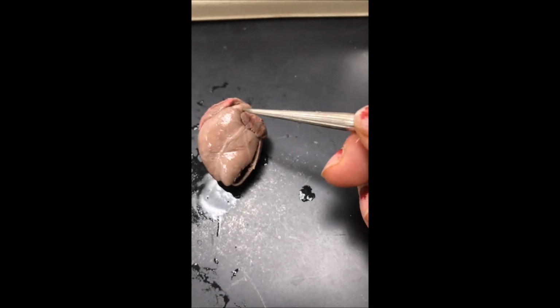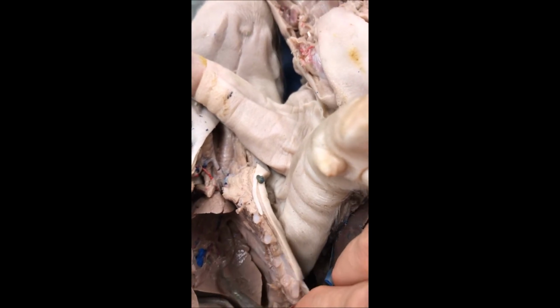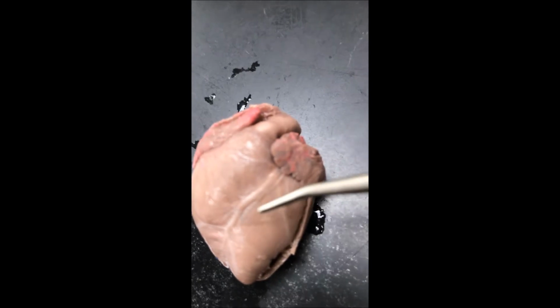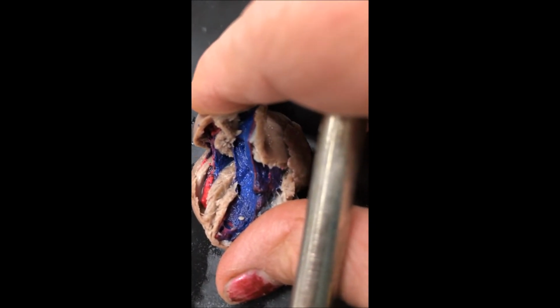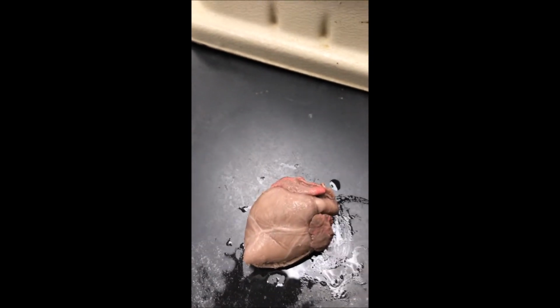The right ventricle pumps it out through the pulmonary trunk, and through the pulmonary trunk it goes to the pulmonary arteries, low oxygenated, to the lungs, and back into the pulmonary veins. Pulmonary veins dump into the left atria. It's small because it's coming from the lungs, into the left ventricle through the bicuspid valve. The bicuspid valve has 2 cusps, and there you have the large left ventricle because it's going to pump a lot of blood up and out through the aorta right there, so it goes to the body to bring oxygenated blood and nutrients to the body.